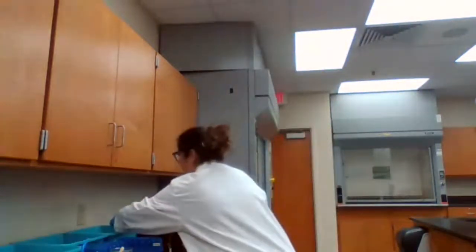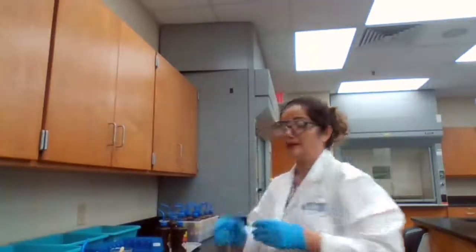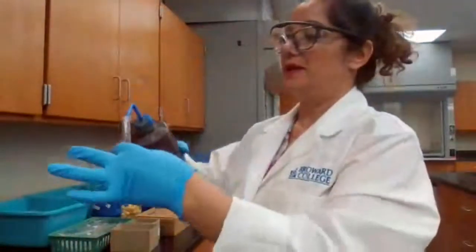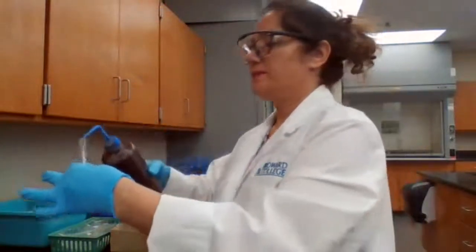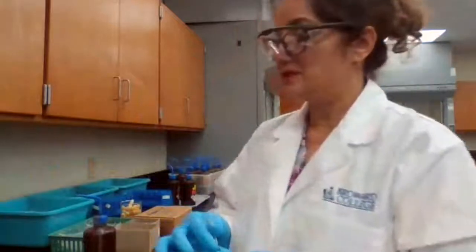Step 1 of the experiment, we are going to prepare hot water bath. Yes, we did prepare the hot water bath. We are going to get 10 drops of the known solution of group 1 and 2. What does it mean is known? That means that all 4 ions are in there. So we get 10 drops into a test tube. Okay. We have 10 drops of the solution into a test tube.